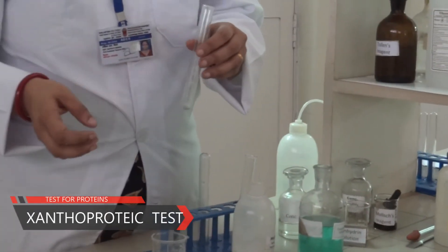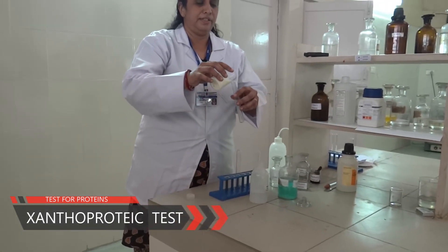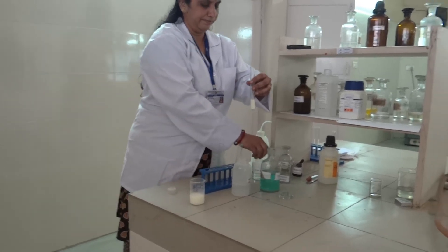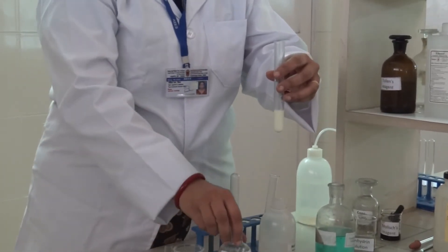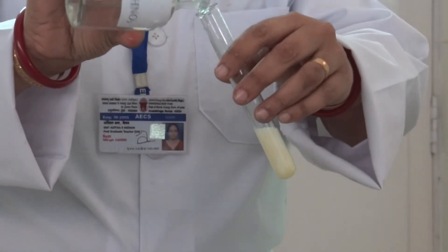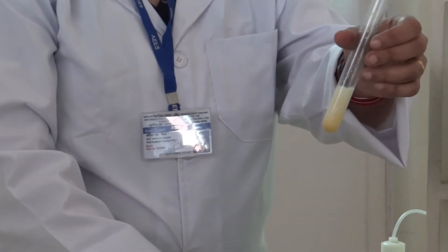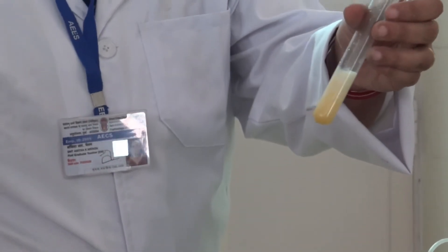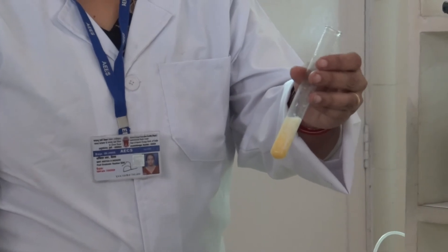The second test is called the Xanthoproteic test. Let's take some food sample and add concentrated nitric acid. You will see that the colour changes to yellow, which shows the presence of proteins in the foodstuff. If concentrated nitric acid falls on your hand, your skin will turn yellow — confirming the presence of proteins in the skin.